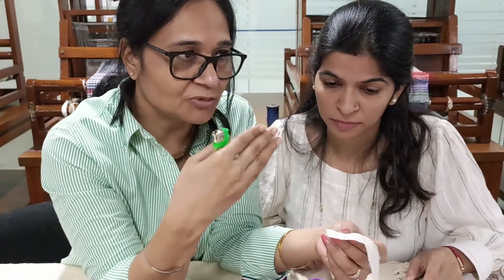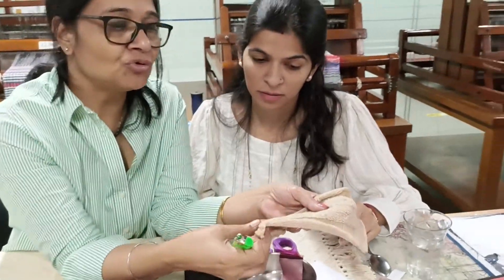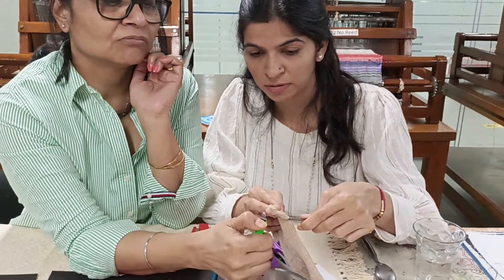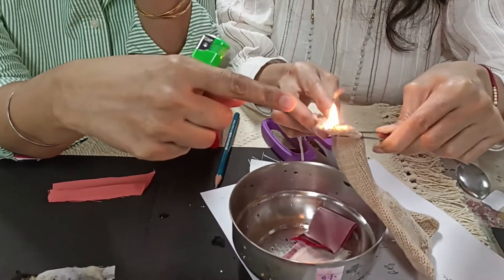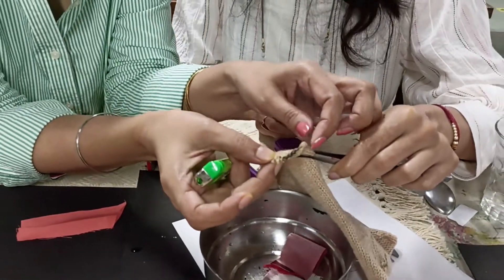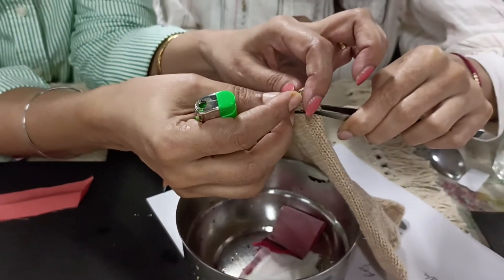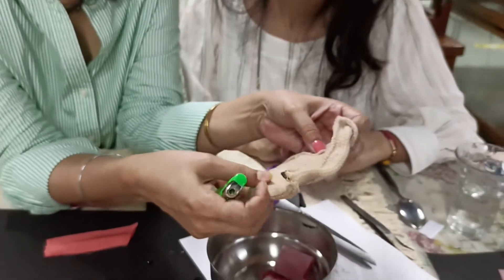This pungent smell is very characteristic — you can use it to identify and distinguish between synthetic fibres like acrylic, which is used for sweaters, because acrylic is going to melt as a synthetic fibre. This is a substitute for wool fabric. Acrylic will start melting and is highly flammable. It forms a molten substance which starts dropping. It forms like a plastic here — don't touch it immediately. Let it cool and it forms a hard edge. This is the difference between wool and acrylic fibres. Acrylic is very popularly used for cheap quality sweaters.